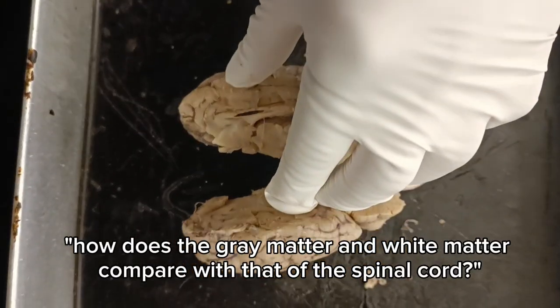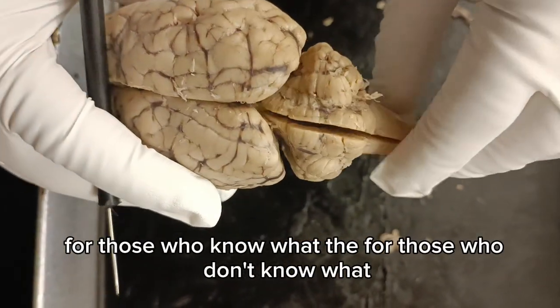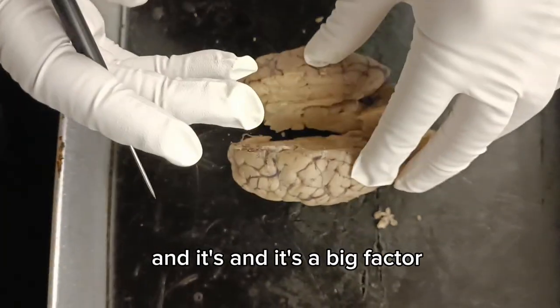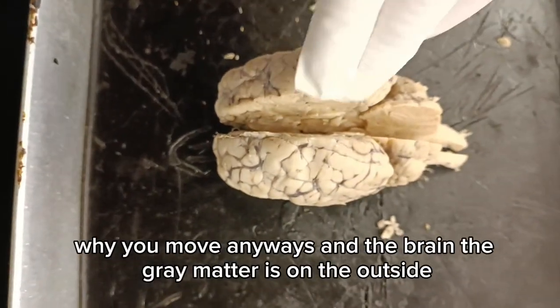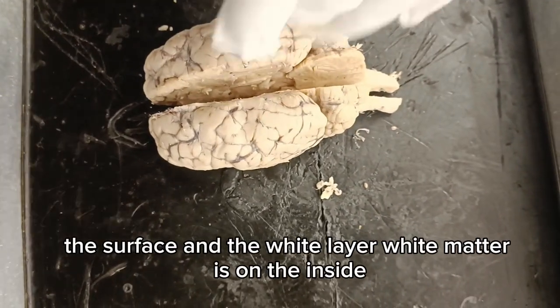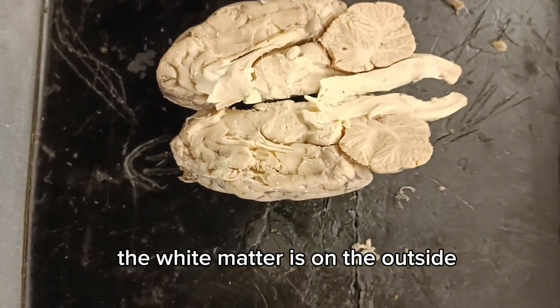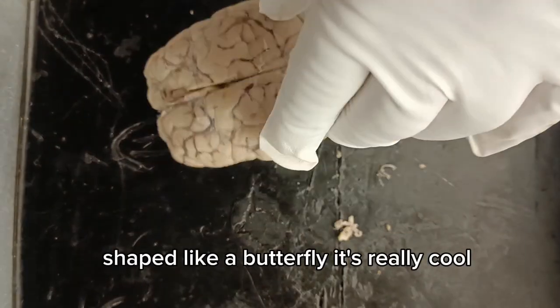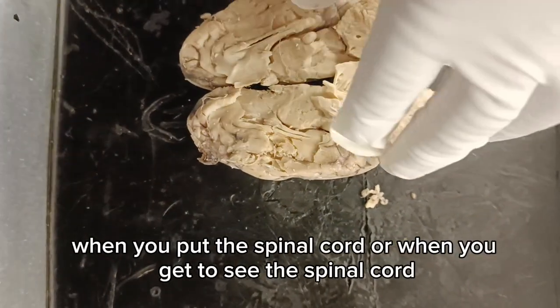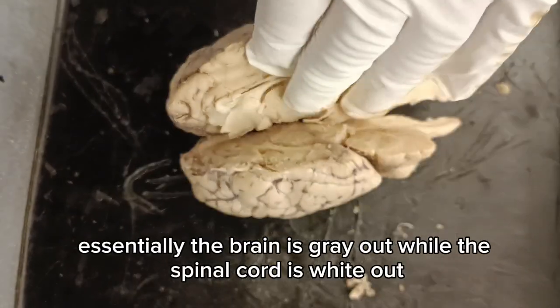Now, how does the gray matter and white matter compare with that of the spinal cord? For those who don't know what the spinal cord is, it's just this really long string that goes down your spine, and it's a big factor of why you move. Anyways, in the brain, the gray matter is on the outside, the surface, and the white matter is on the inside. In the spinal cord, it flips. The white matter is on the outside, and the gray matter is on the inside, shaped like a butterfly. It's really cool when you get to see the spinal cord. Essentially, the brain is gray out, while the spinal cord is white out.